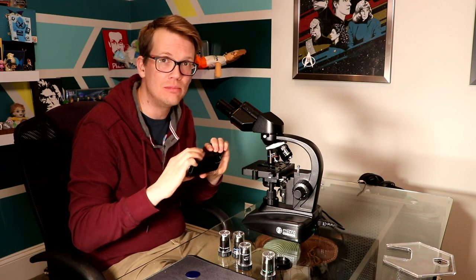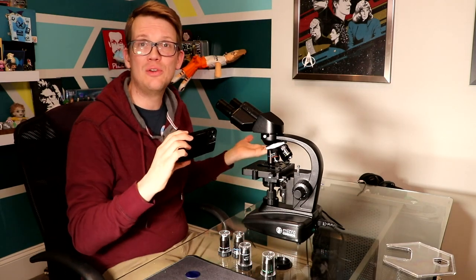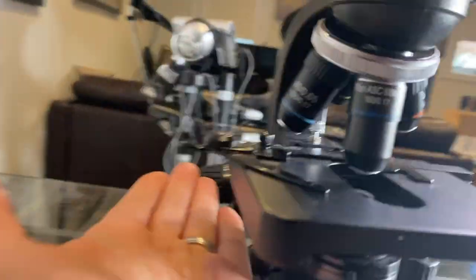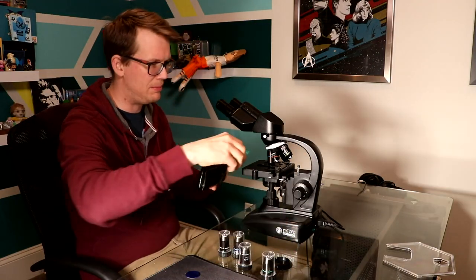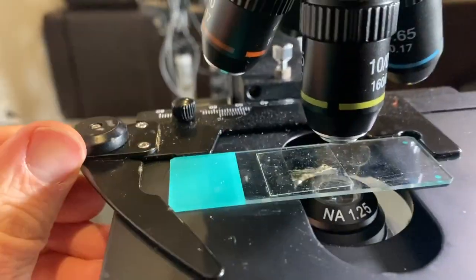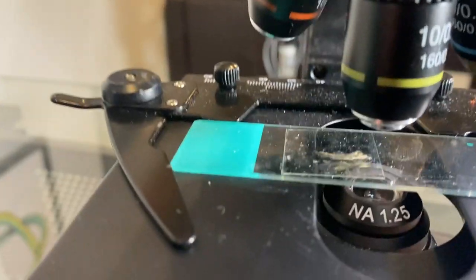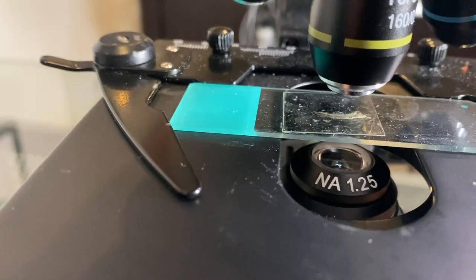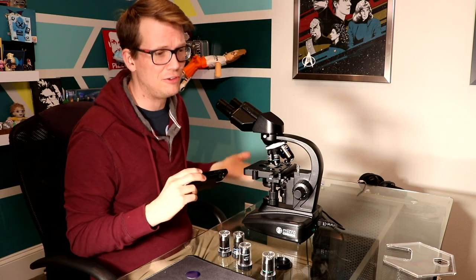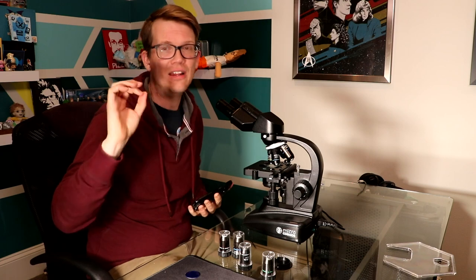When it happens, you will notice immediately because the sample will move — it will get squished a little bit so stuff will be moving around. And it won't be alive. Unliving stuff will be moving around, and that's how you know that you've just hit your slide. If you keep going, you might break the slide. As we continue to move up, now we've got our stage. This is the stage where we put our slide. I've got some dried out samples here — I let my samples dry out, which means I killed a bunch of microbes. You pull this out, put the slide in, put this in, and then it's locked in place, pinched here and pinched here. Then when you use these knobs, it will move around. This takes a while to get the feel of — you'll be thinking you're going backwards a lot. You'll think you're going to go up and you're going to go down. You get used to it pretty fast, though. The way that James can chase a microbe is a feat of skill and talent that has been developed over many years.